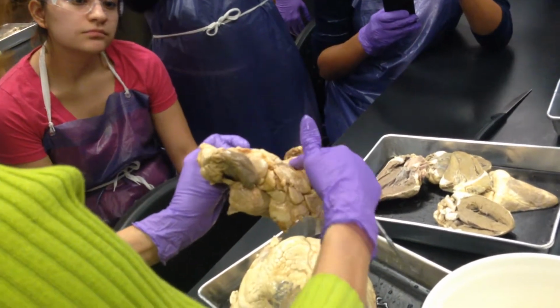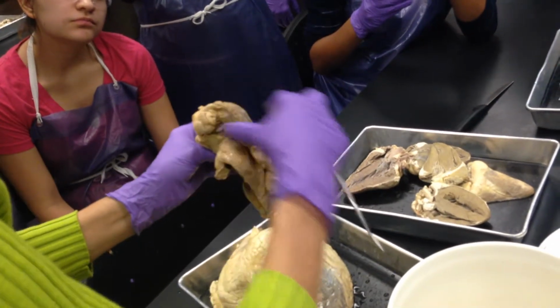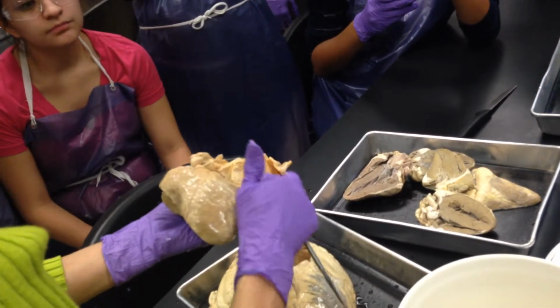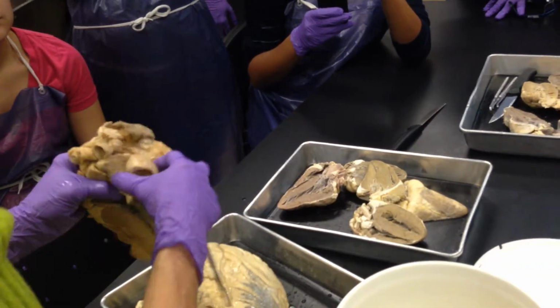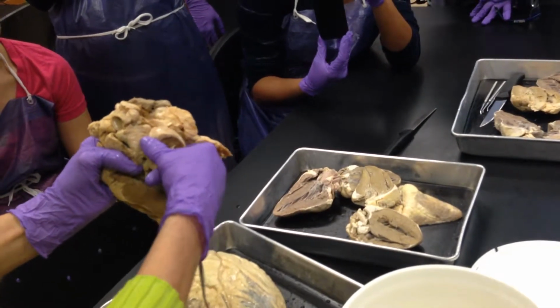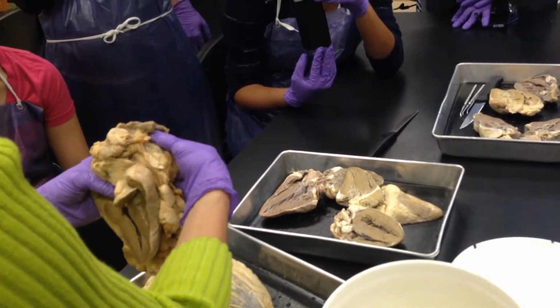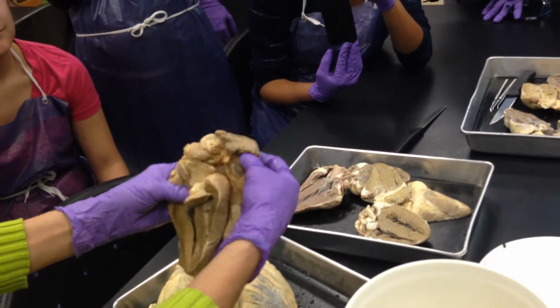Let's see that again. We put it over like this. Fibrous pericardium on the outside. See how it's attached to all of the blood vessels here at the top, what we call the base of the heart. And then on the inside, lining the inside, see how it changes texture? That's the parietal pericardium. And then the space between it, if I could put my fingers here, would be that pericardial cavity where the fluid is secreted. This is visceral pericardium. Anybody recognize what this is? A little piece of what? A thymus gland. Very nice, Whitley. A little piece of the thymus gland.